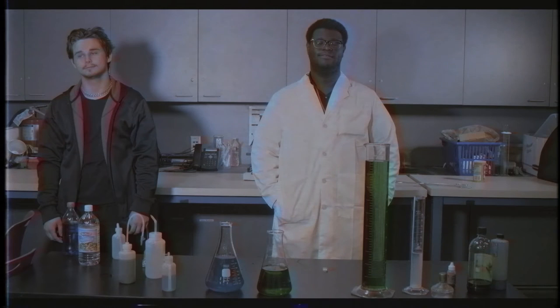In a lab, it is extremely important to wear the proper safety equipment. Let's look at our two assistants. A fine example of proper safety wear. Goggles, check. Lab coat, check. Shoes, check. What do we have here? Goggles? No. Lab coat? No. Shoes? Definitely not.